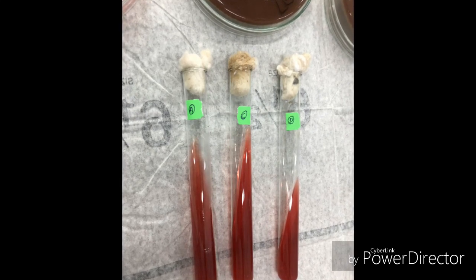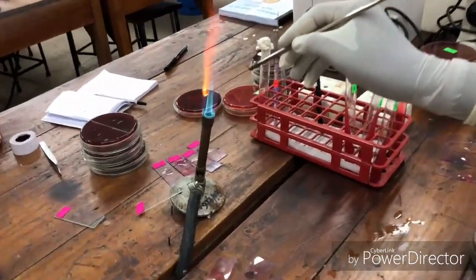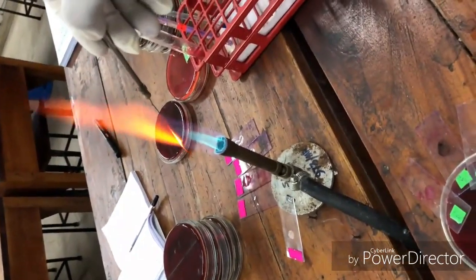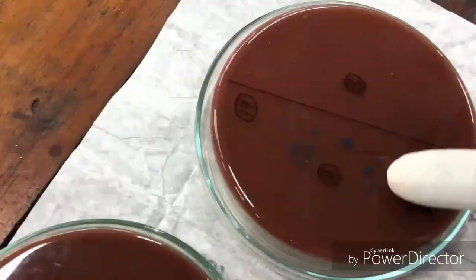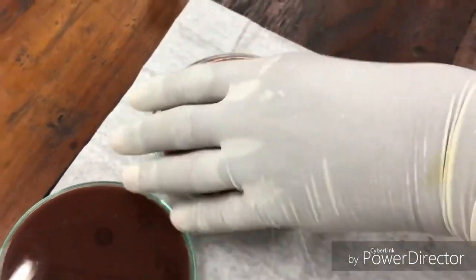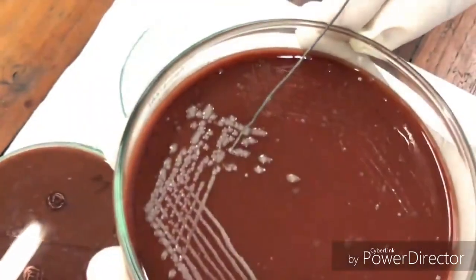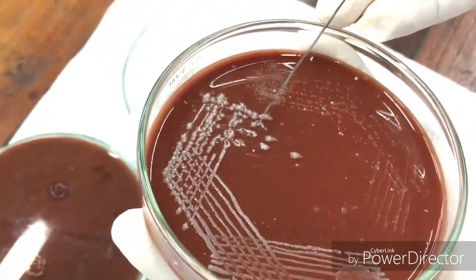Here we use the straight wire to pick the colonies and introduce them into the KIA slants. I am sterilizing my straight wire. Now let's see how we can introduce the colonies into the KIA slants. I am picking the colonies from the chocolate agar with the straight wire, then introducing them into the KIA slants.